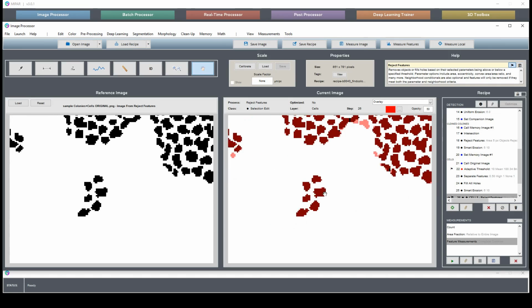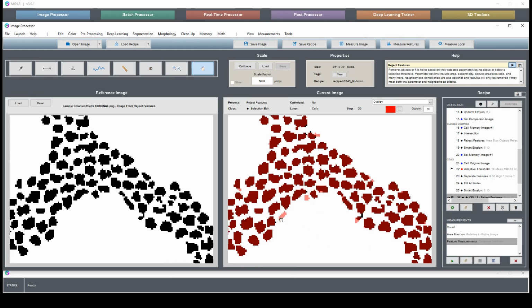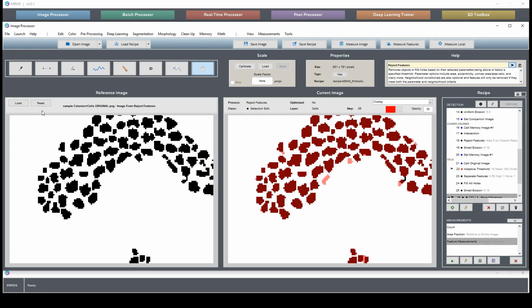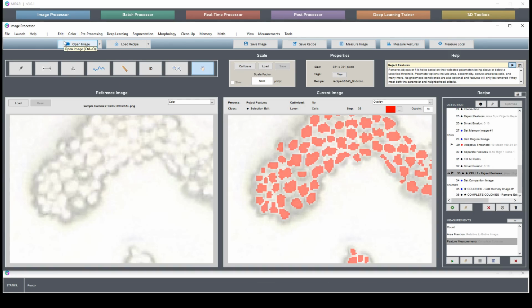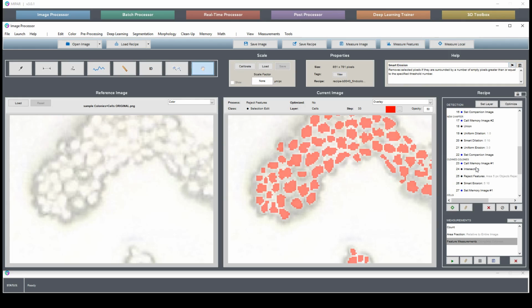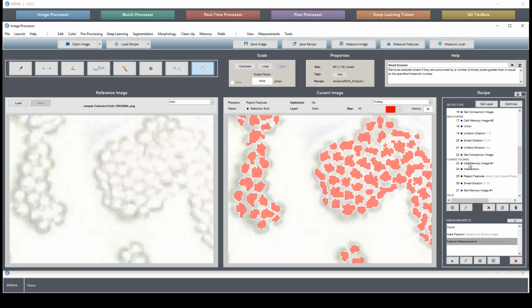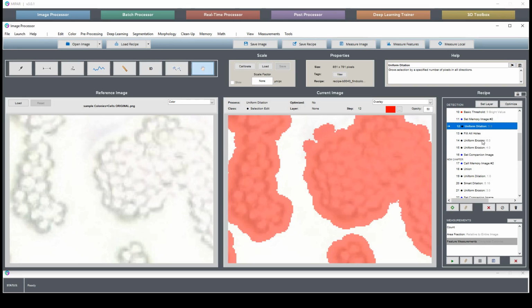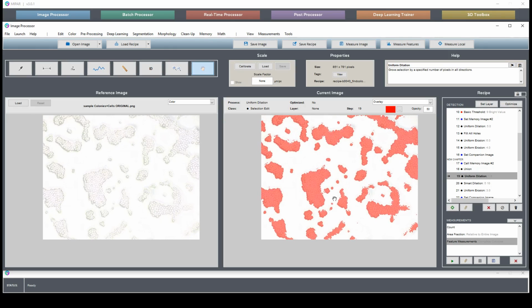These cells here, this here, several over here. All these that are now no longer inappropriately found. Okay. And remember, our concept for motivating this particular set of cleaning operations was differentiating the center of the feature from the outside of the feature. We had an aggressive closing operation in order to fill in the centers. Then we eroded it away, added our tight edges back, and did a more gentle cleaning in order to get the edge found appropriately.